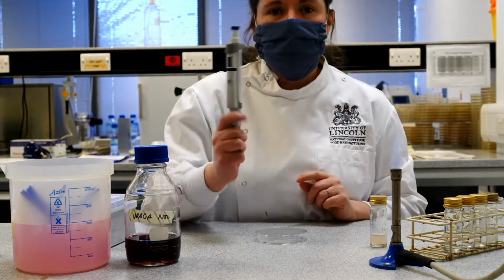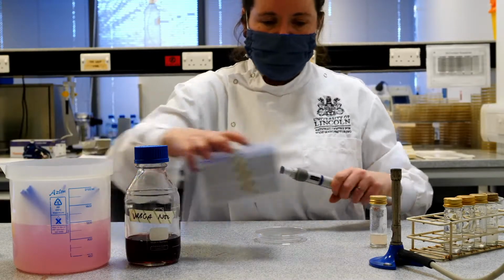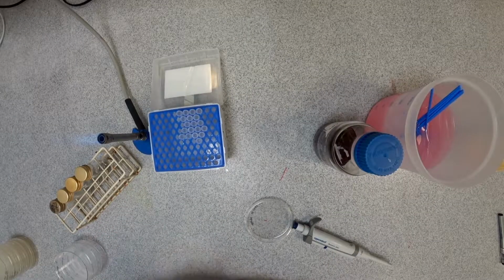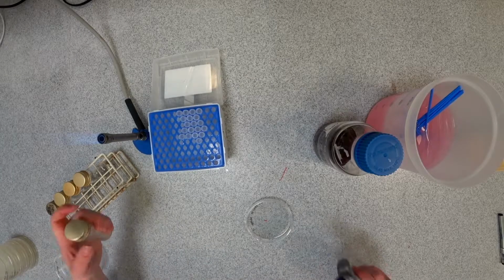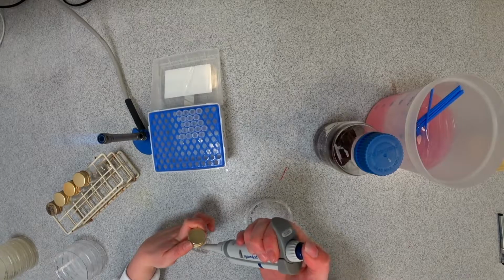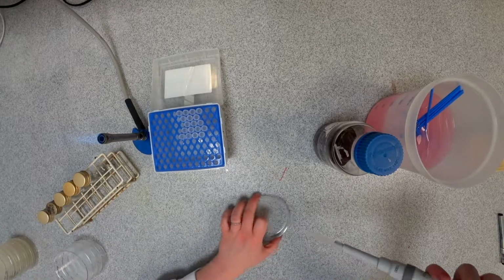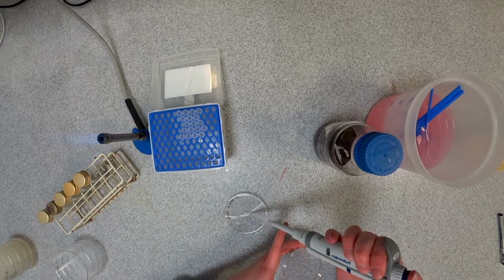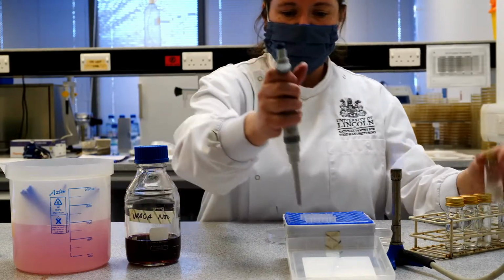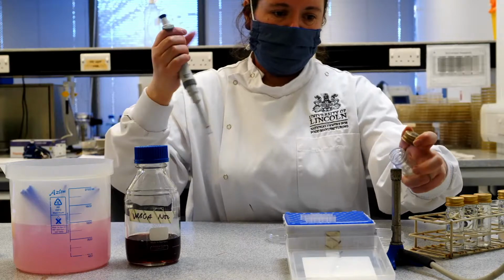So I'm going to go back to using my 1000 pipette, so set up to measure 1000 microliters of liquid, and the slightly larger tips again. And this time I'm going to put our dilution directly into the empty Petri dish. So withdraw 1 milliliter of my sample, dispense it into the empty Petri dish. And I'm going to do it slightly differently this time. I'm going to set up all of my dishes first before I work with my molten agar.